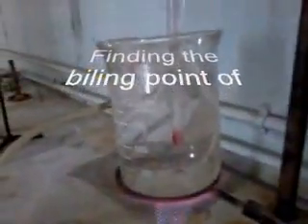Today the experiment which we will perform is used to find the boiling point of a given liquid. The apparatus used for it is a fusion tube — the tube which is in my hand — and the capillary tube, the small one which is inside it. The liquid of which the boiling point will be found will be added in the fusion tube with the help of a dropper.